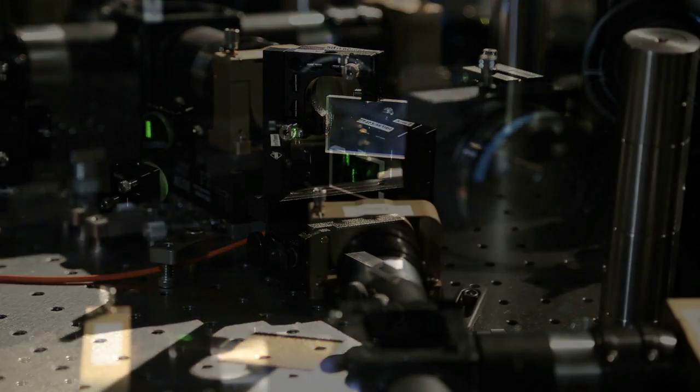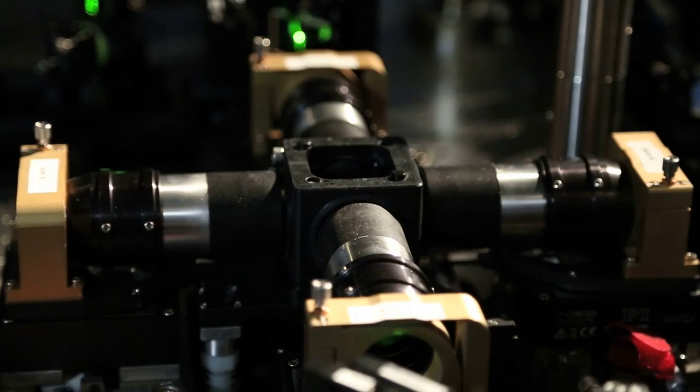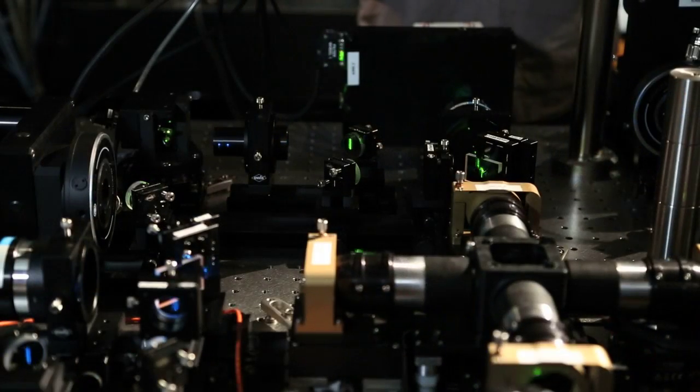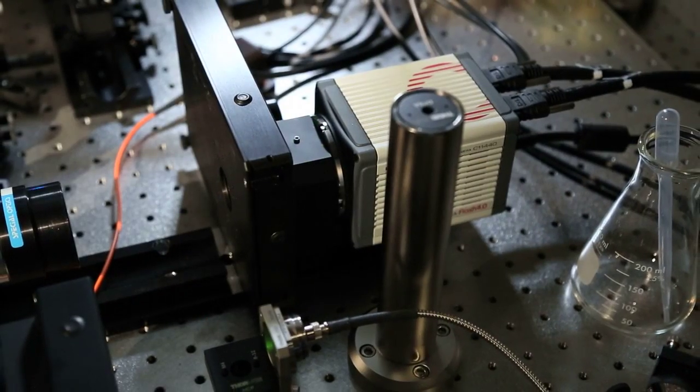Then at that point, we have a dichroic mirror in the beam path. It's a beam splitter, so it takes the illumination beam, directs it towards the objective, and now through the objective, we finally get to the sample. And once that light hits the sample, it excites fluorescence in the sample, and that fluorescence is collected by the cameras in the orthogonal directions.